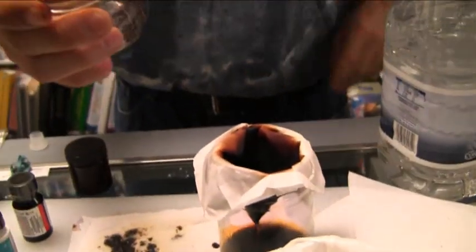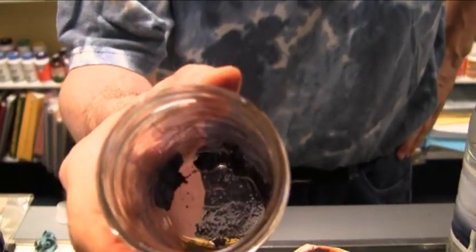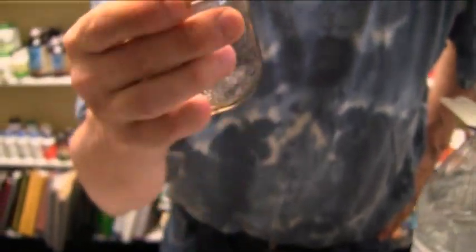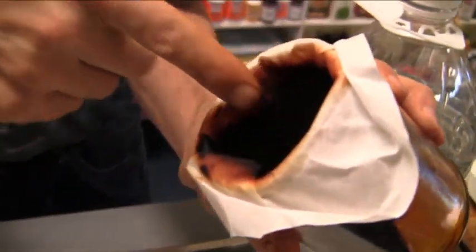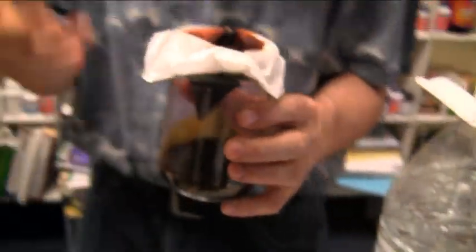And what you have is crystal. You've just made your own iodine crystal. Like I said, this has got to be rinsed out, and away you go. This is basically just leftover and you may see some residual crystal there — it's of no consequence. Anyway, you've made it. I just showed you how to make it, I showed you how to screw up, and I showed you how to fix it.